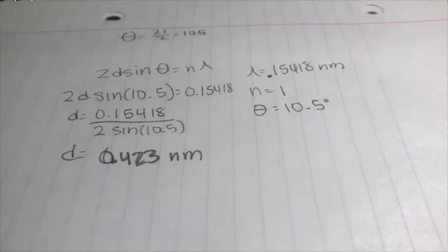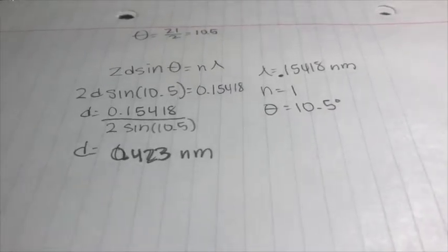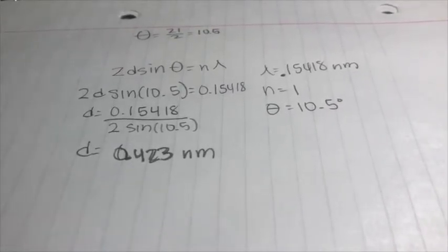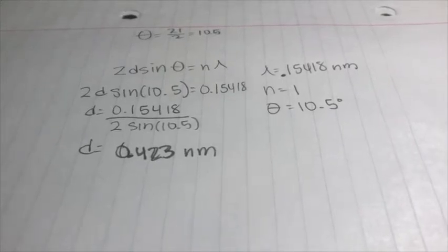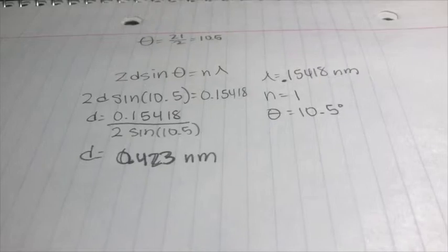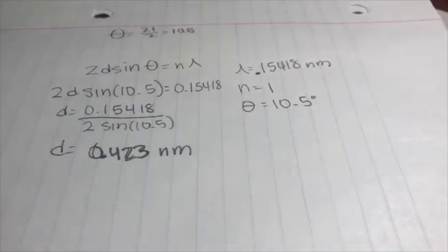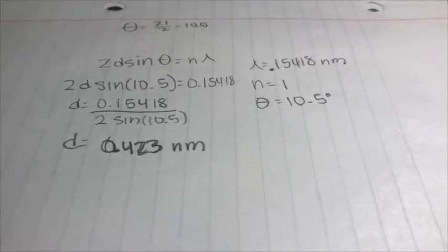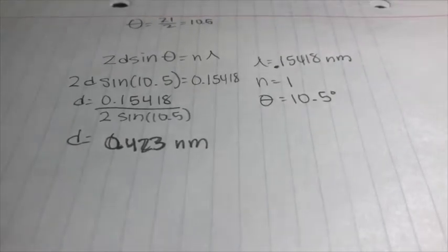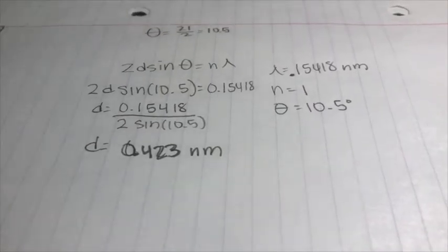Now I'm going to talk about how to use the X-ray powder data on Canvas to calculate the d-spacing for the most intense peak in the diffraction pattern. So first of all, the reason why we use X-ray diffraction is because the X-rays deflect off parallel planes, the ones created by the d-spacing. And so there's this formula called Bragg's formula, which is written out right here.